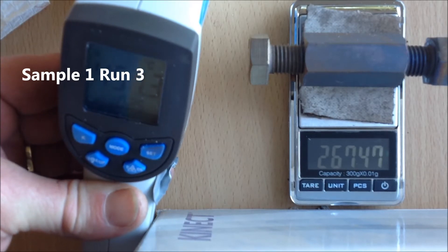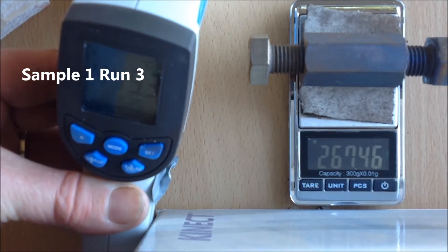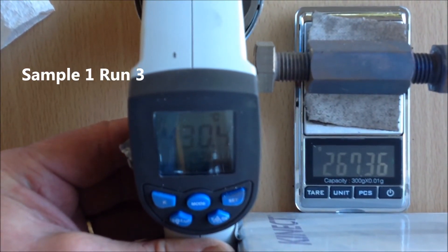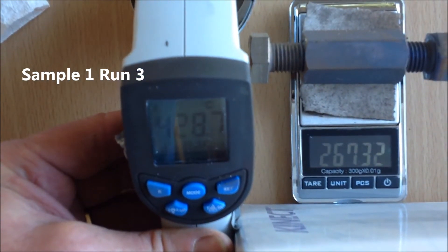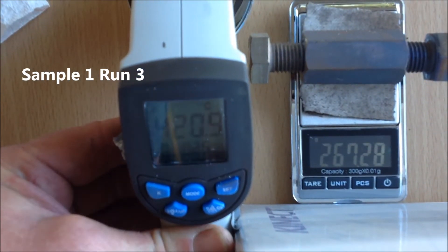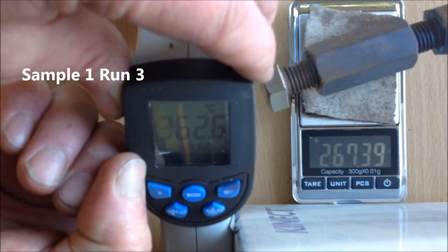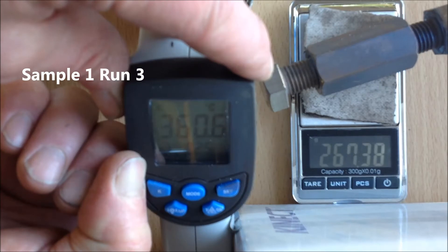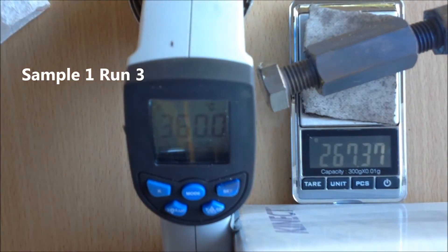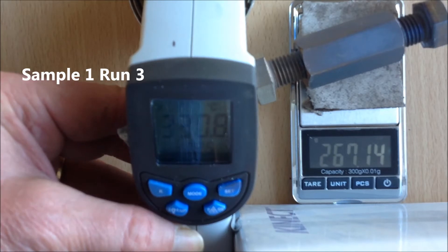277.98. 298.50. 298.60. 298.50. 288.70. 309.70. 309.60. 308.50.